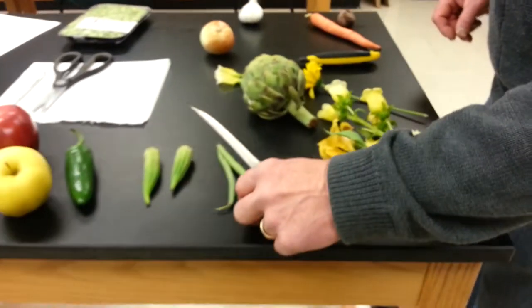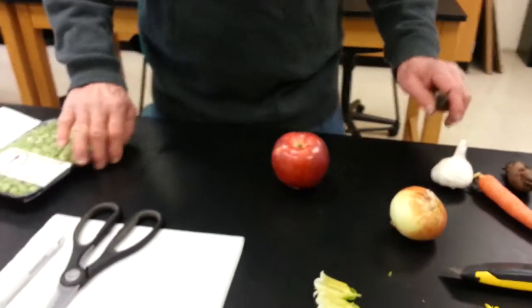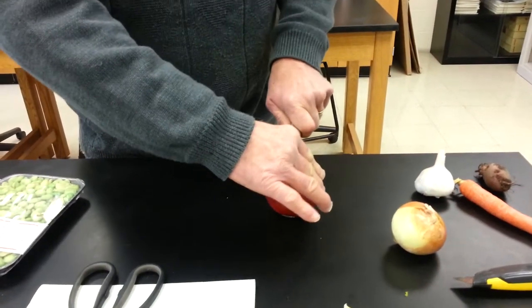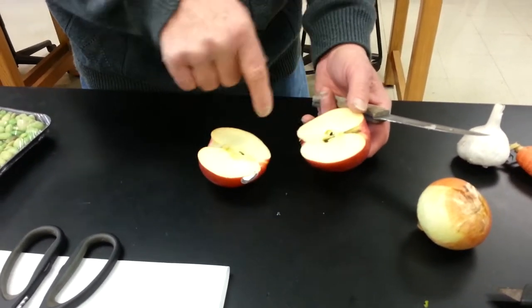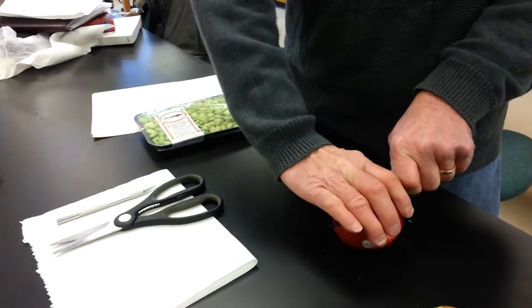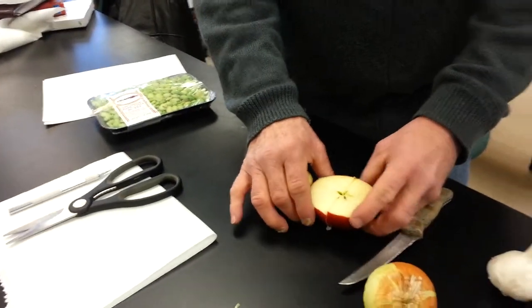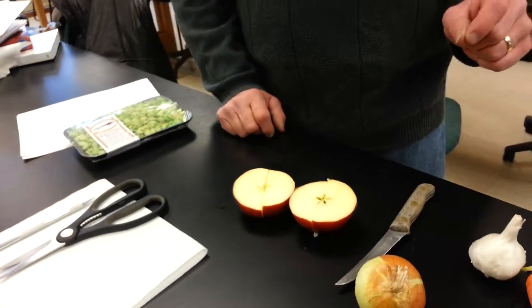Just to show you another example, we're going to do two sections of an apple. I'm going to show you how to make a vertical cross section, which exposes one set of anatomical features, and then I'm going to put it back together and show you a horizontal cross section. The horizontal view is dramatically different than the vertical view. As you do these dissections, you'll want to keep that in mind and perhaps do two views for your selected plant. Points will be awarded based on the number of structures you're able to correctly identify and label.